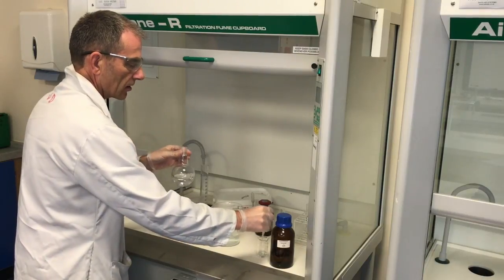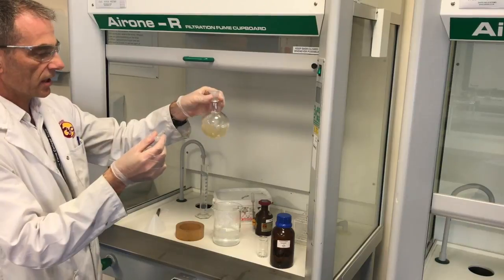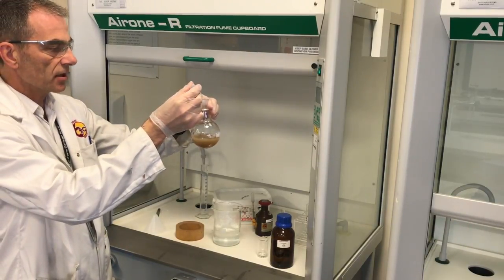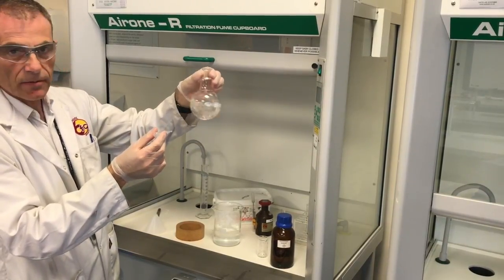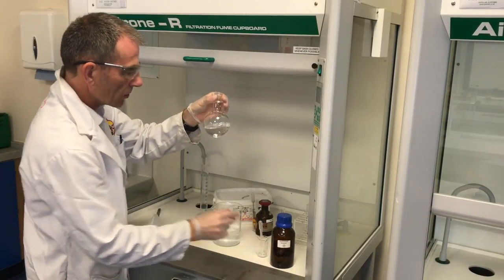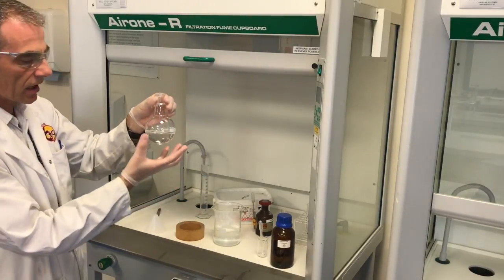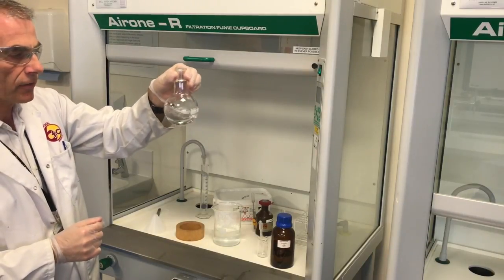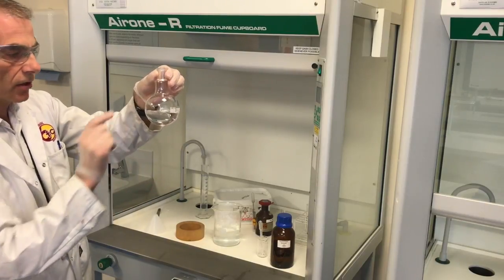I'm going to start adding the concentrated ammonia. We're getting that brown precipitate, so we'll keep adding until the brown precipitate goes. The precipitate's gone now. I'm going to put the flask into the beaker of boiling water to get it warm, so that when we add the glucose I can just swirl it out of the hot water and hopefully see the silver coating appear on the flask.